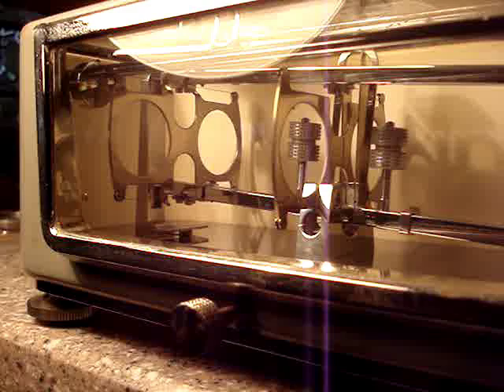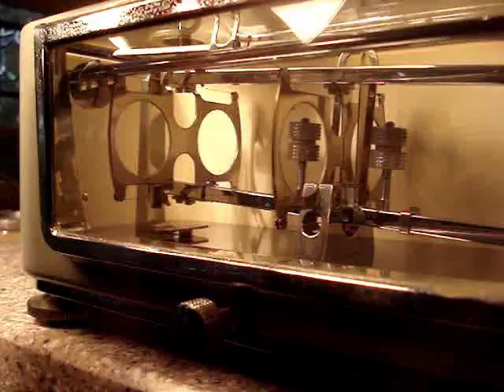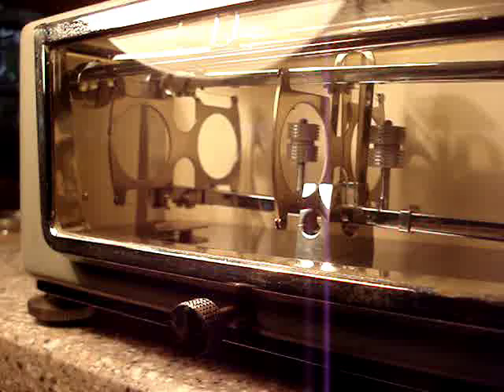This is the torsion balance. It'll weigh up to one gram. Here's a piece of paper, approximately three inches square — one of these stick-on notepad things. I'm throwing it on the left pedestal there, and hopefully you can see the mechanism working in there. This has six hair beams in it. Maximum capacity of this scale is one gram.